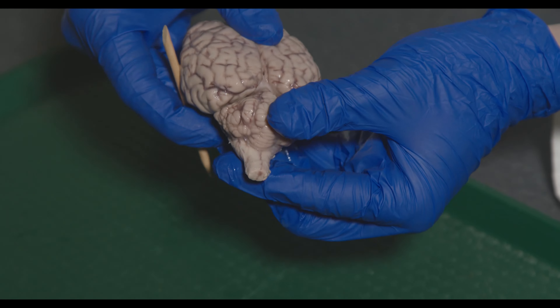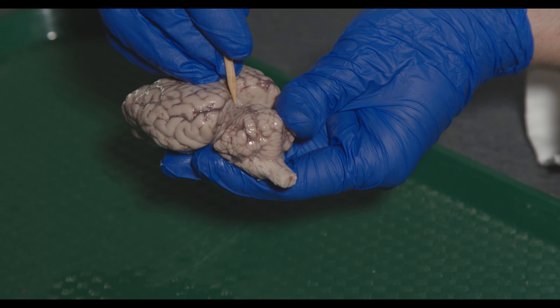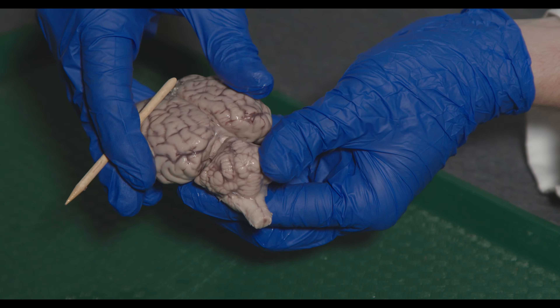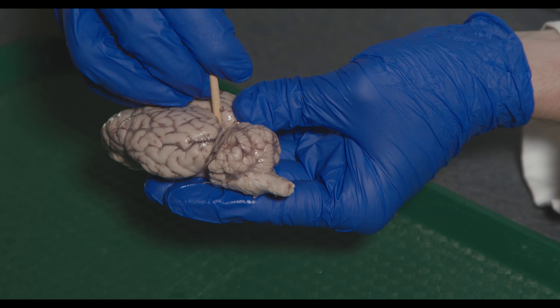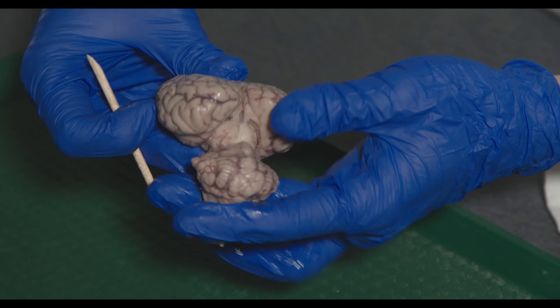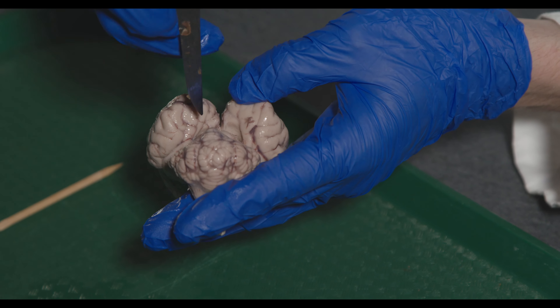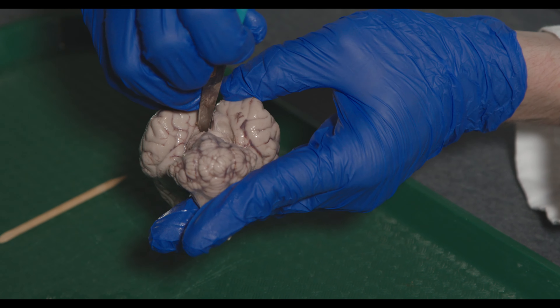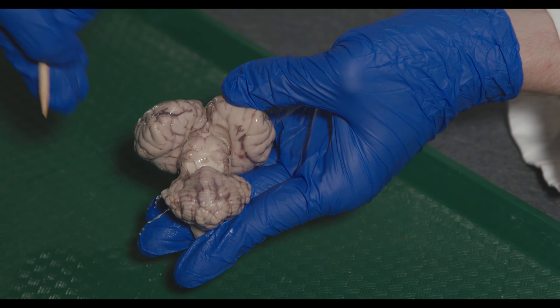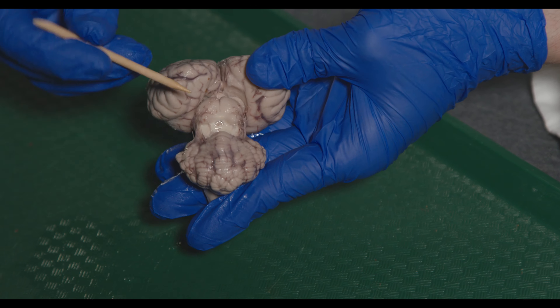For the rest of the dorsal structures, I'm going to pull the cerebellum down a bit. There's quite a bit of tissue here, so I'm going to gently remove some of the arachnoid and wedge in to separate them, so we can see some of these deeper structures — particularly I want you to see the pineal gland. I'll use the scalpel a little to carefully get rid of some of this arachnoid.